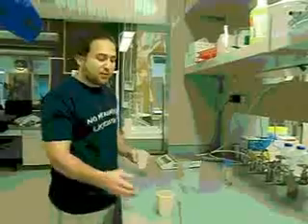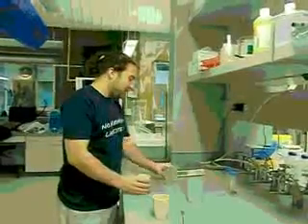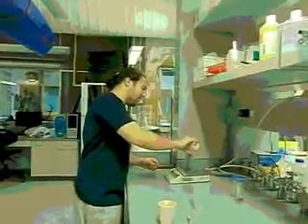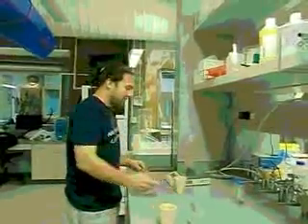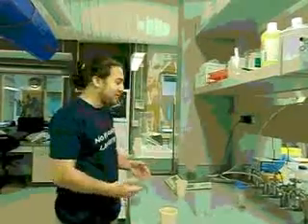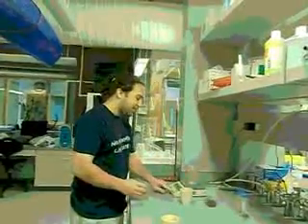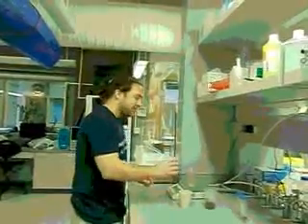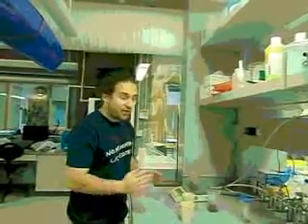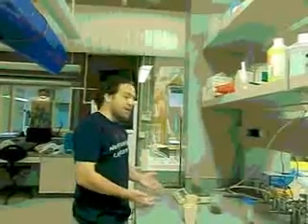Alright, now that we have our samples with the carbon burned off, we're going to reweigh them. So, put your cup on there, you re-zero it, and you dump your sample in. Oh wow, look, it doesn't weigh as much as it did before. That's crazy. Put your other sample on there, re-zero it, put your sample in, and remember, you need to record all the data you get. Oh, look at that. Why don't you record this number? Now it's at 8.2 grams.